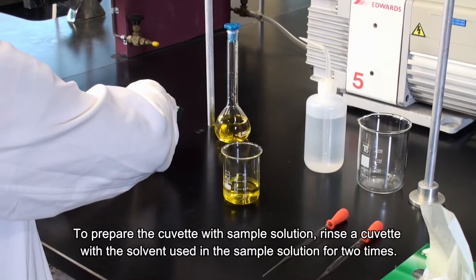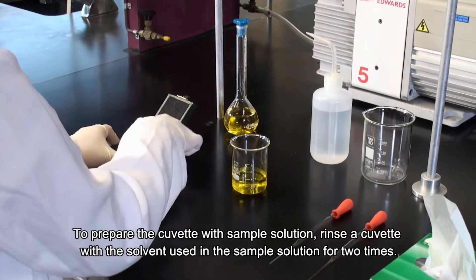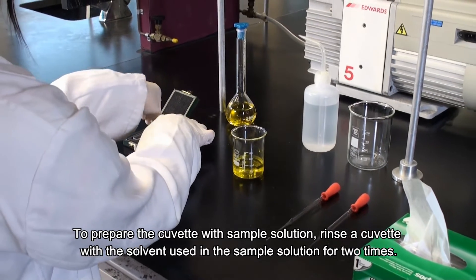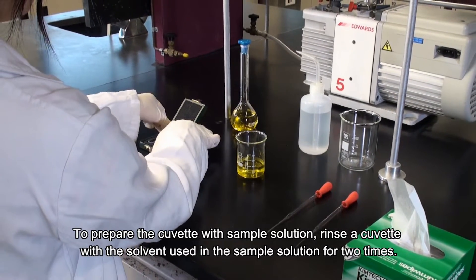To prepare the cuvette with sample solution, rinse a cuvette with the solvent used in the sample solution for two times.